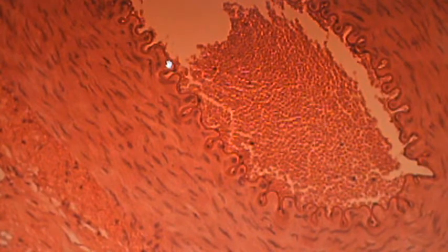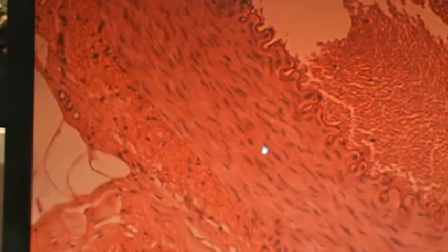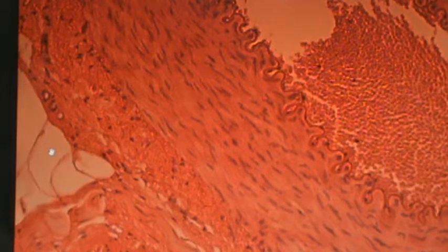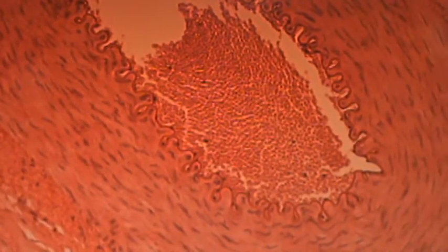One layer, simple squamous. And then again, out here, the major tissue type is muscle, and this is smooth muscle. Okay? Let me just pan across this tissue slide. Oh my goodness, what do we see right here on the edge? Yeah, that would be adipose. Right there. So major tissue type connective, specific type adipose. And in this area beyond the smooth muscle that you see right there, out here would be some more areolar connective tissue. Okay, go on to the next one.